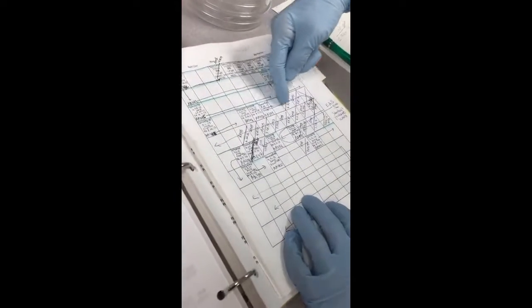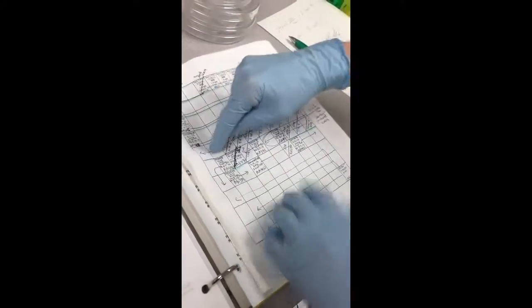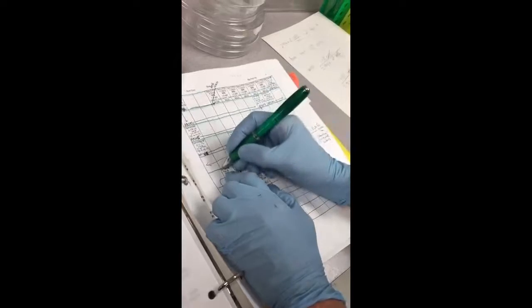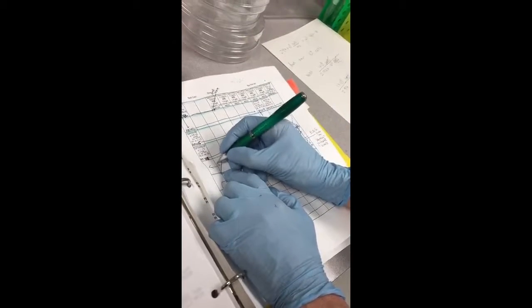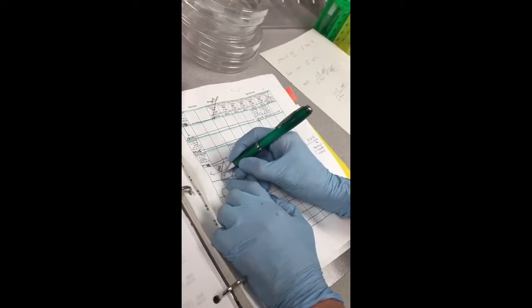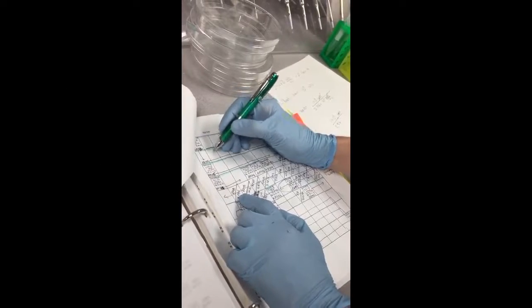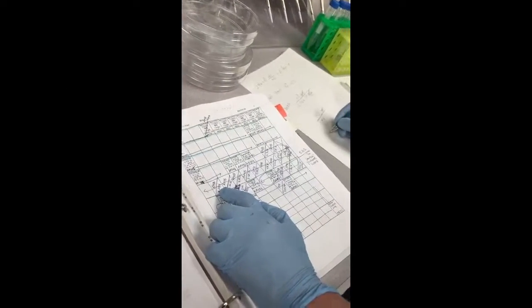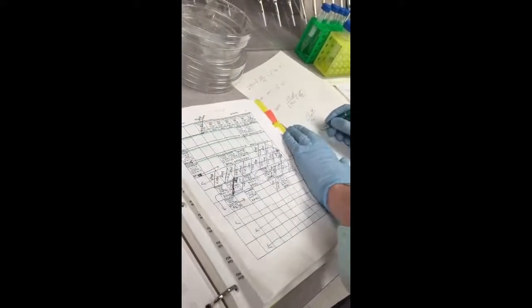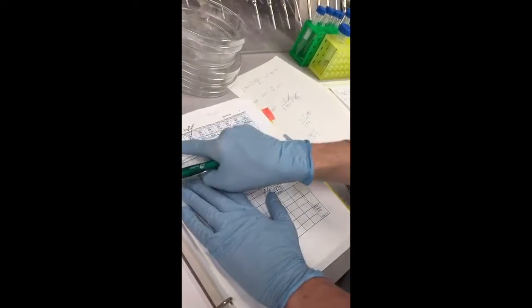Here's one. And if you look, there's a little arrow that goes all the way down here. Oh, look, there's one right there — I'm going to take that one. When I take this, I'm going to put my initials, RMB, and today's date, 6-27-16. I'm going to note this is row 5, column 2, in blue rack 4.